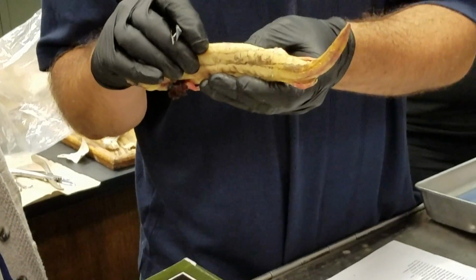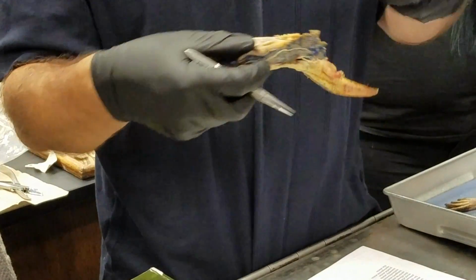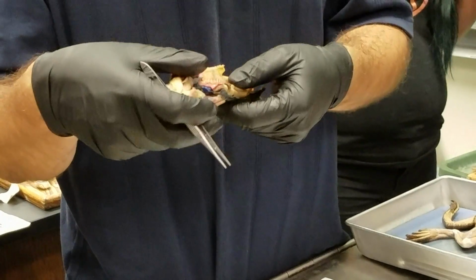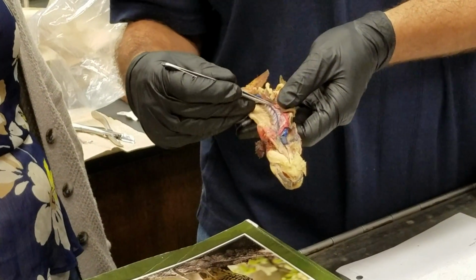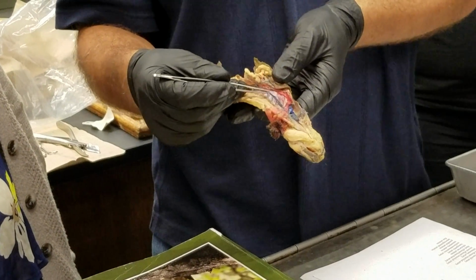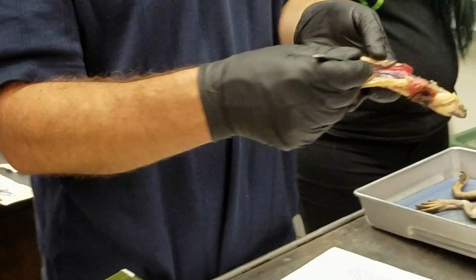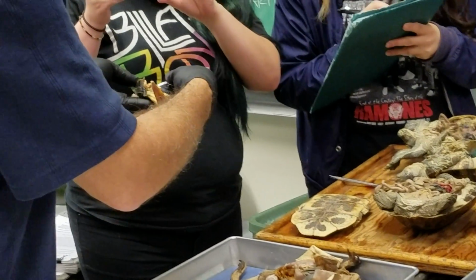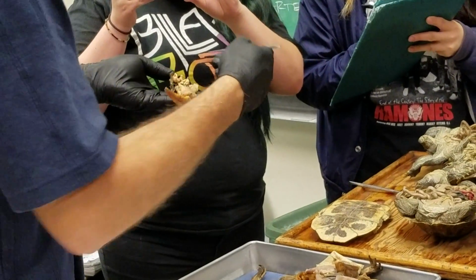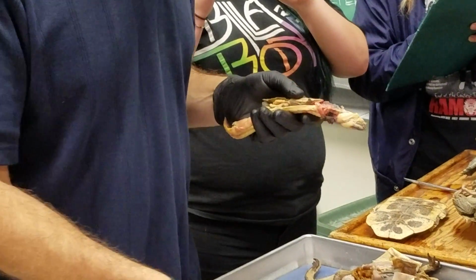And the renal portal vein will run forward. Maybe it's better on this side. Yeah, you can see it more easily. On this side, it runs forward like this, and basically when you get in front of the kidney, it's called the posterior cardinal vein. That's the posterior cardinal vein there. And that's going to then run into the common cardinal and back to the heart.